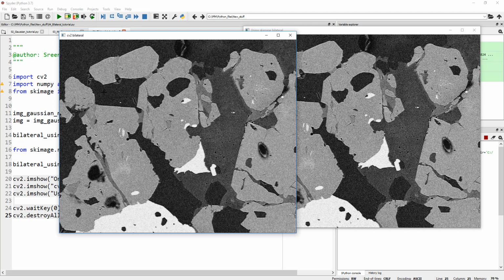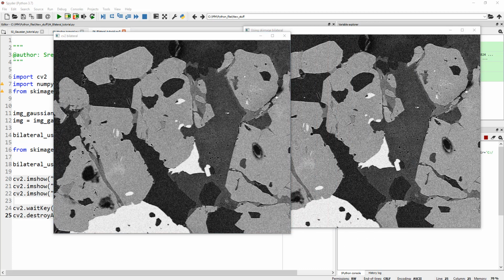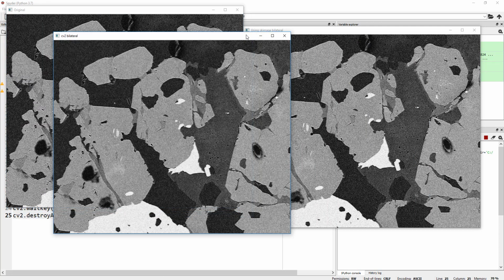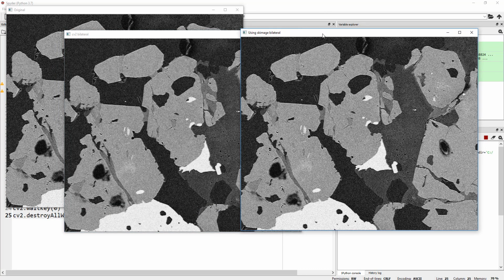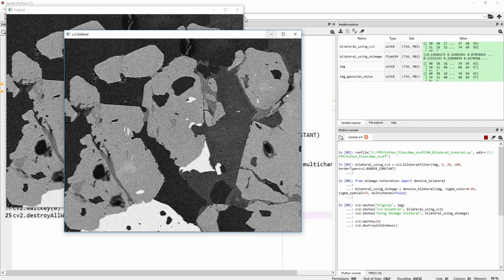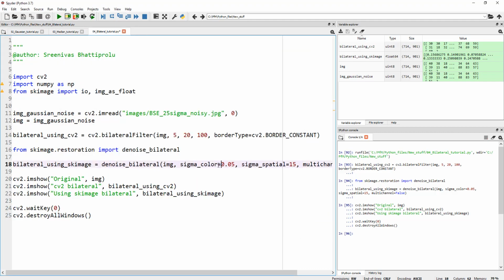So where is my original image? It's got to be somewhere. Oh, it's hiding over there. So this is my original image, and this is the bilateral using OpenCV, and here is the bilateral using scikit-image. In fact, OpenCV did a slightly better job. Again, it probably depends on the parameters over there. But again, go ahead and play with these numbers, sigma color and sigma spatial.